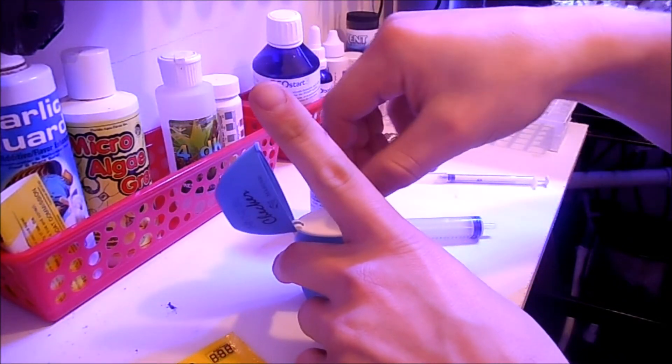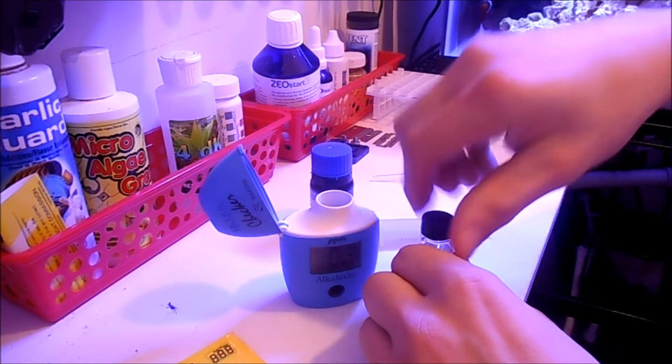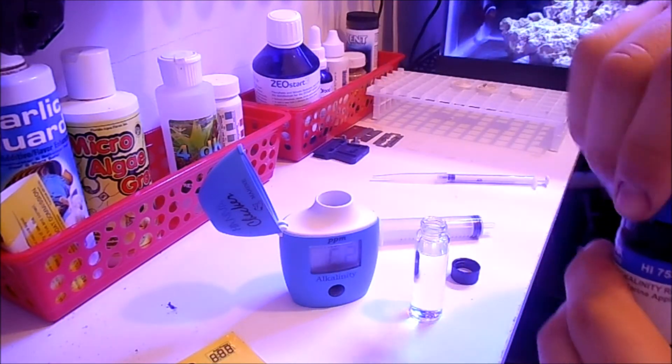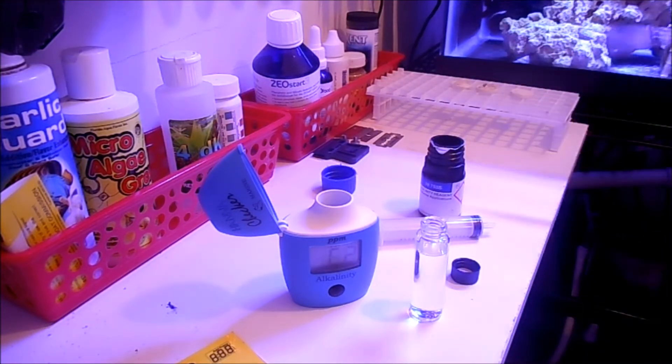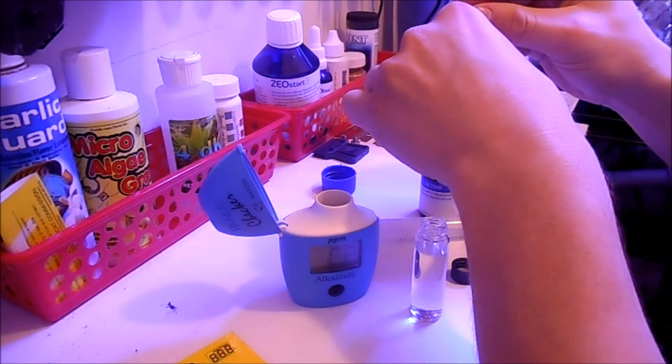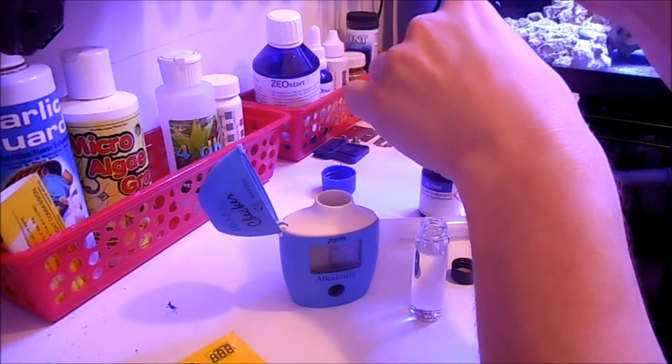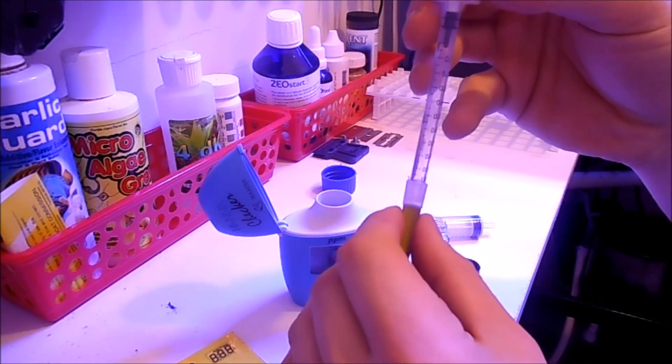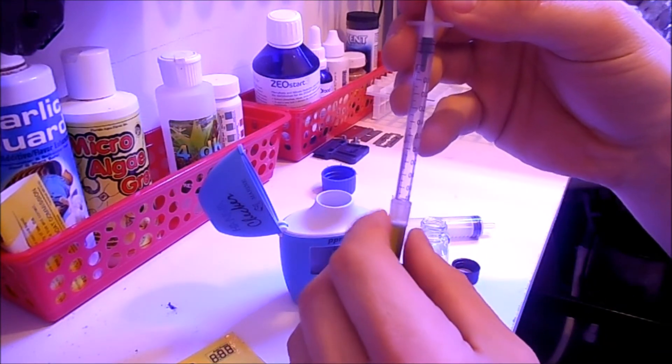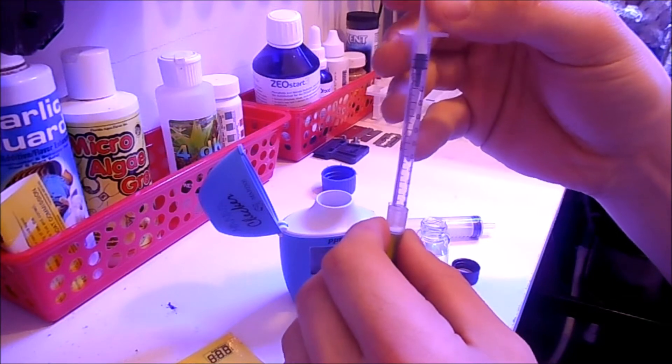At this point I take out the reagent here. We got it completely full. Now you want to bring it down to 1ml.